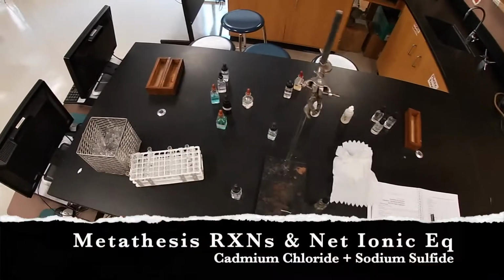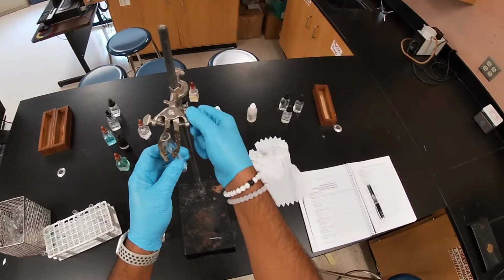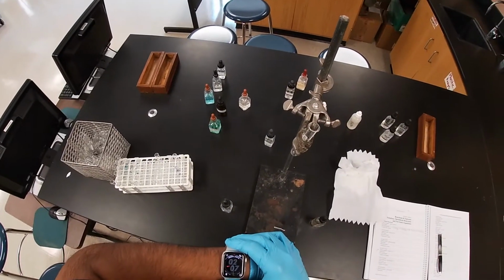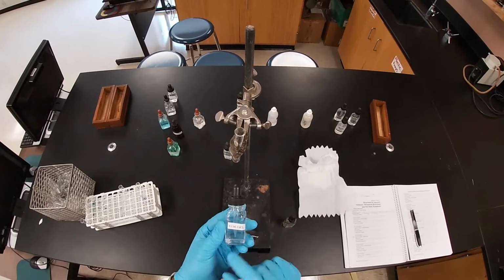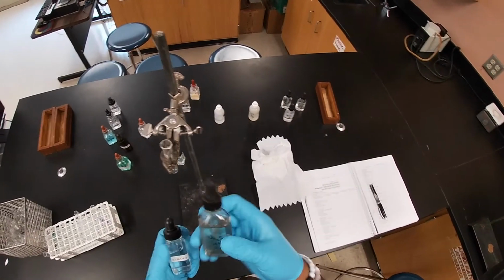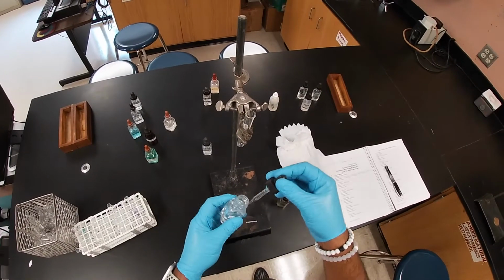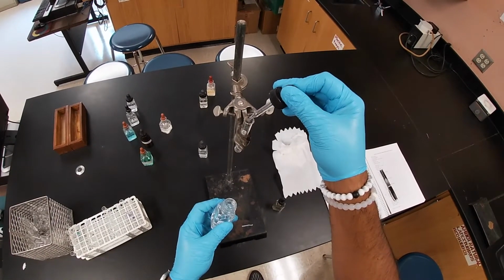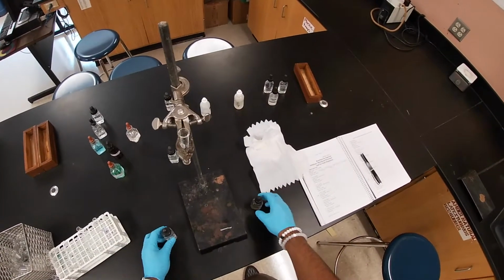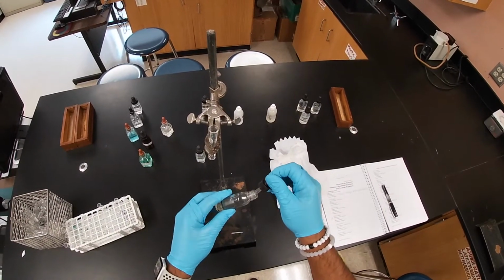Okay, in this reaction, we are going to have number 6. It's going to be between cadmium chloride and sodium sulfide. For this reaction, as you can see, we have our dropper full of CdCl2 and our other dropper of Na2S. We're going to do the same process, have our test tube right there. Going to add a dropper full onto our test tube of cadmium chloride, and then now we're going to get the sodium sulfide one. We're going to add a dropper full as well.